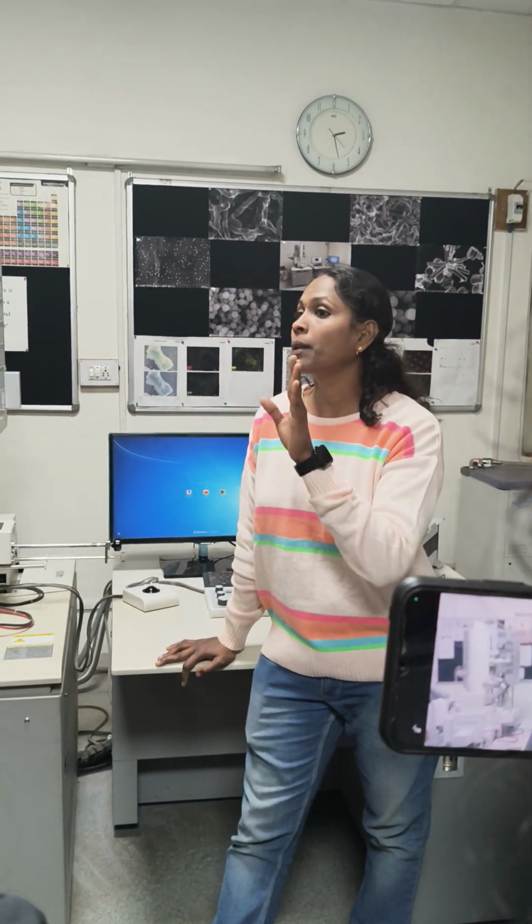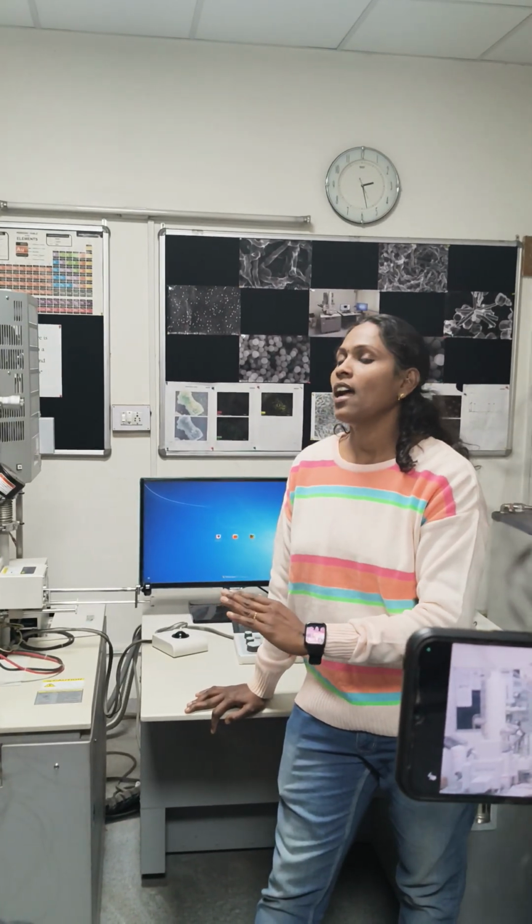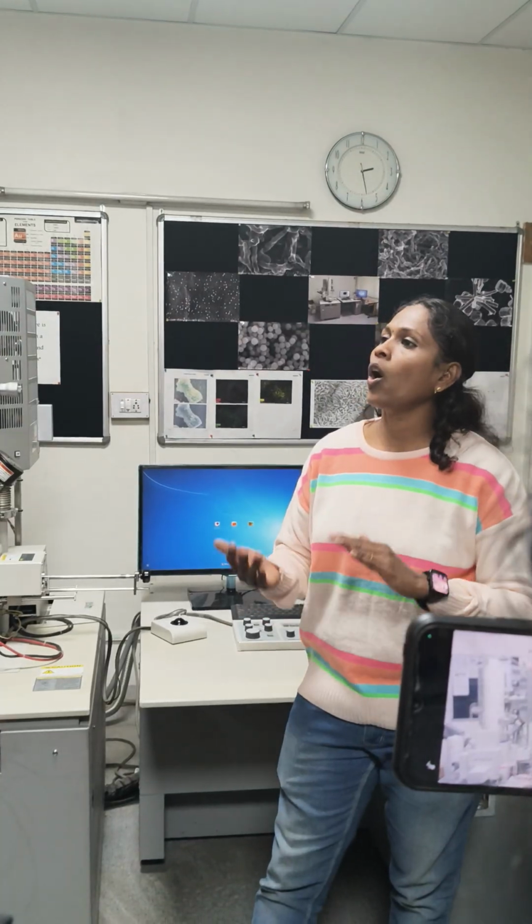So for material science also, and for biological samples also, whatever the sample is, it should be dry. And the sample preparation is very important. And after the preparation also, how you preserve your sample is very important.